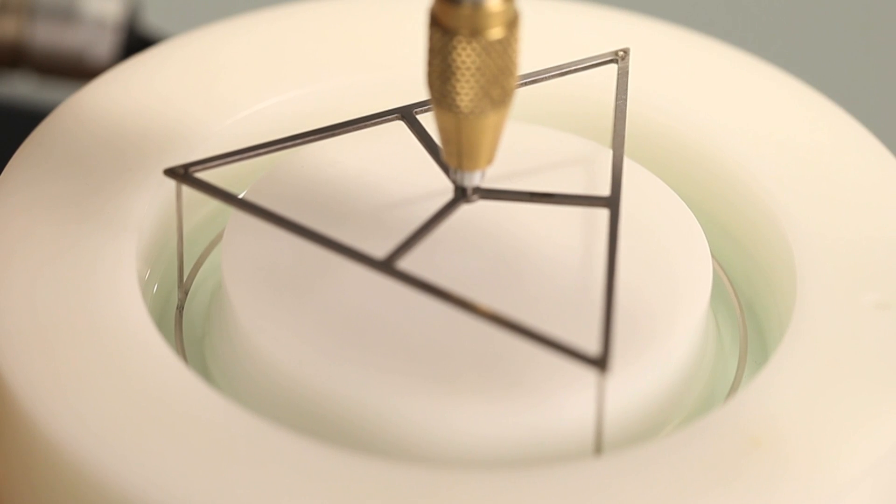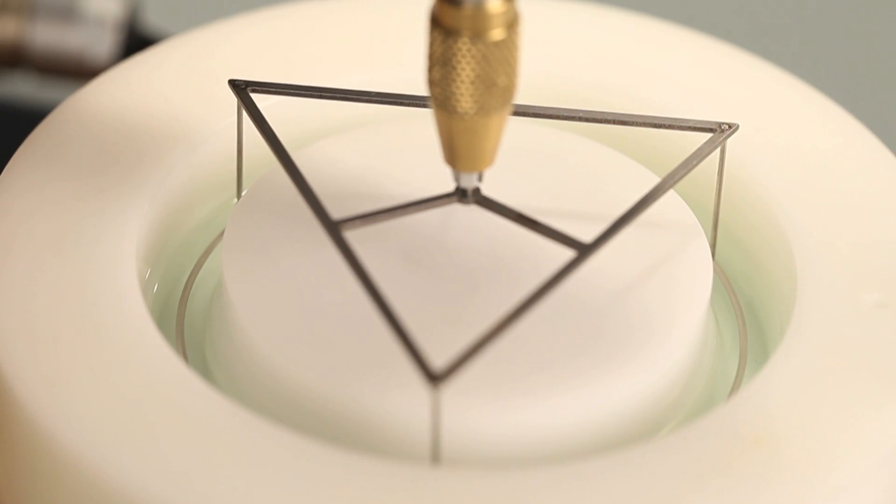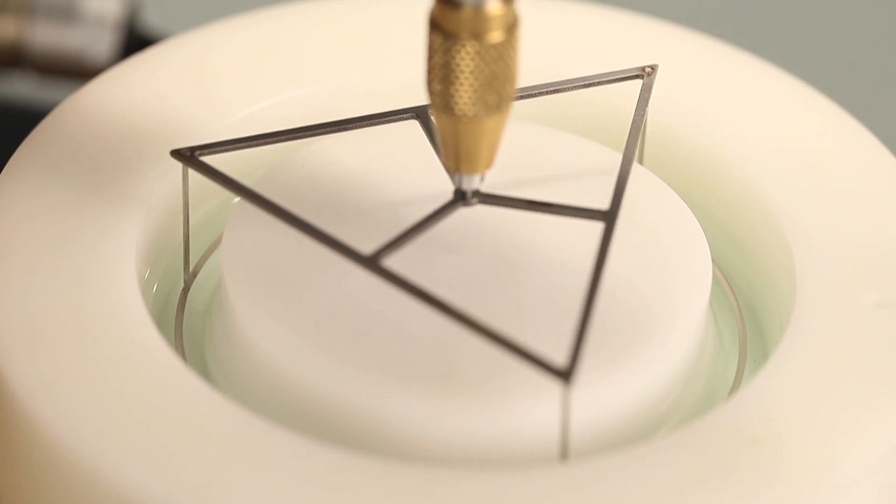The sample and ring are now set up for liquid air interfacial measurements. If you are testing the interface of two liquids, you can load the top phase and begin testing.